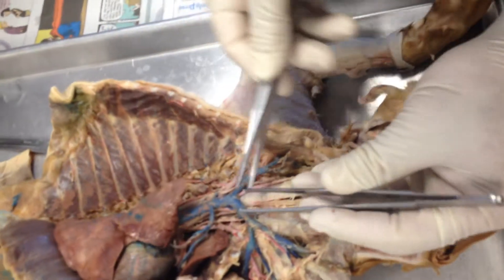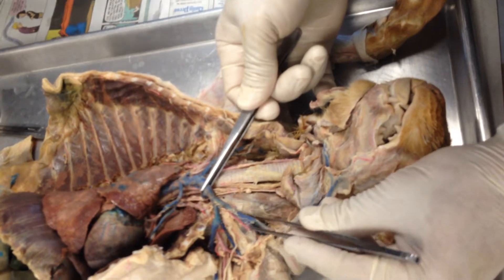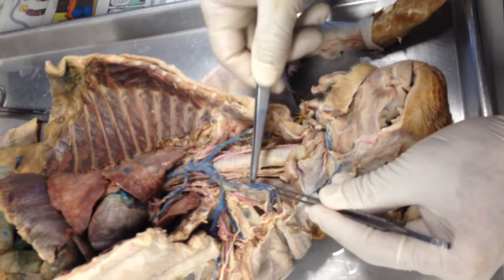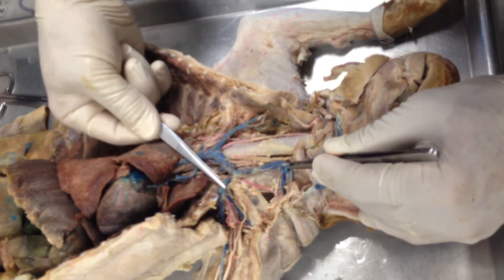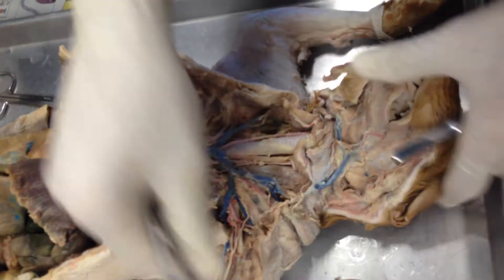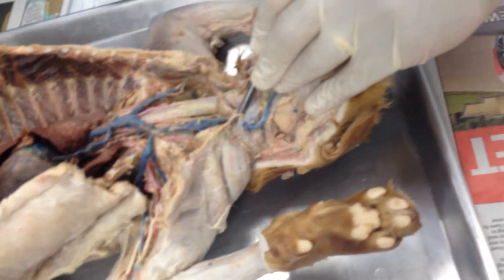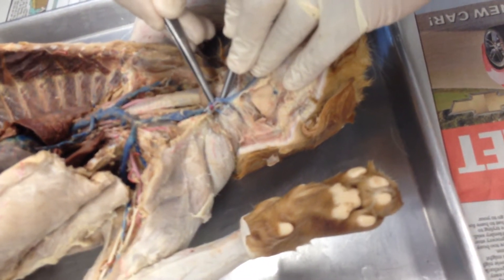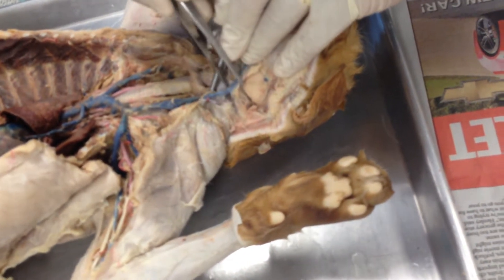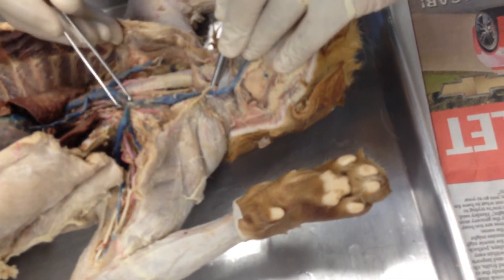Now we come over here to the brachiocephalic vein. The brachiocephalic vein has two branches draining into it: the external jugular right there and the subclavian right there. Now we look at the external jugular — it's outside the body there, inside the body there — and it drains into the brachiocephalic.